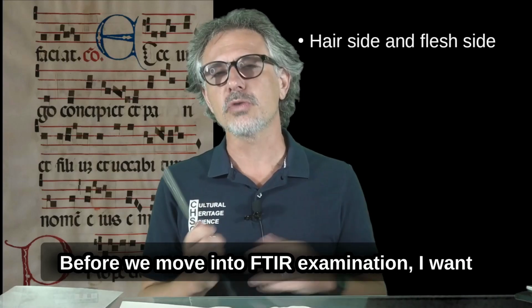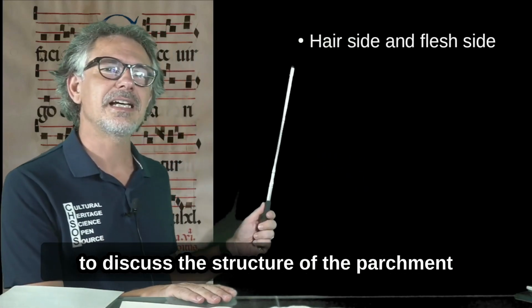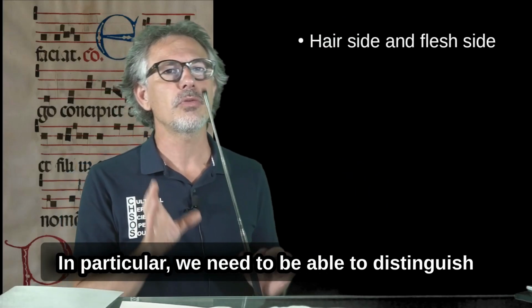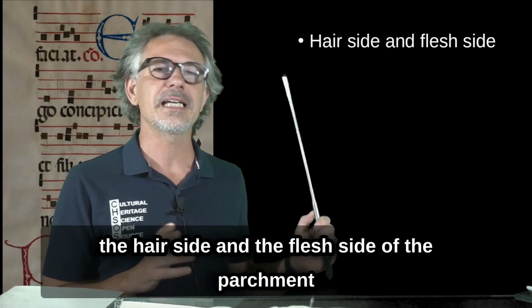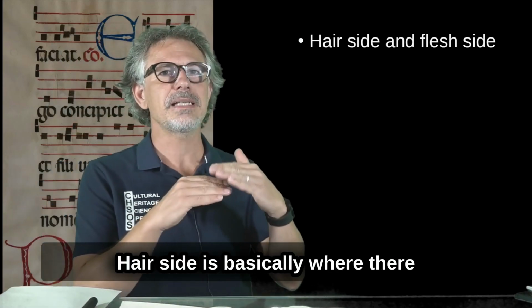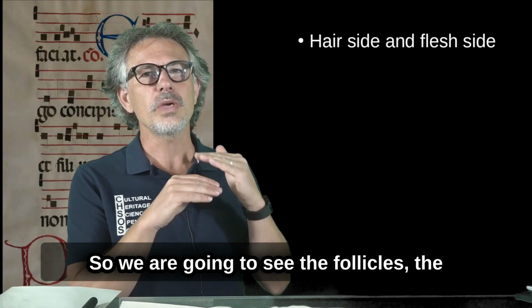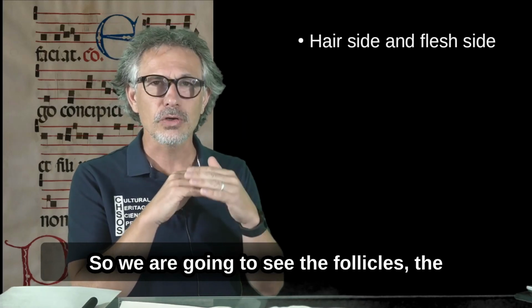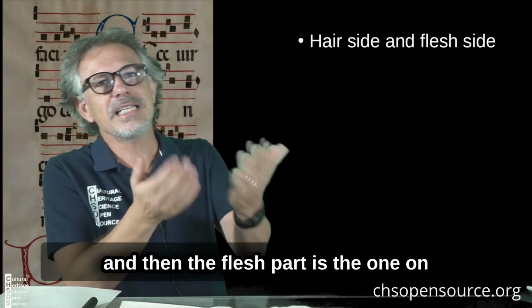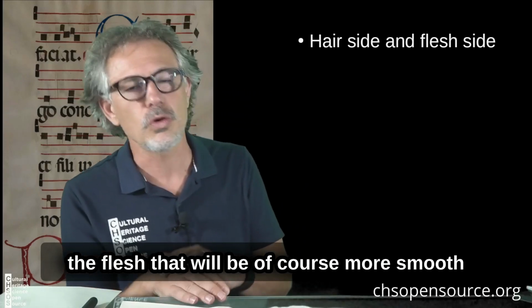Before we move into FTIR examination, I want to discuss the structure of the parchment. In particular, we need to be able to distinguish the hair side and the flesh side of the parchment. The hair side is basically where the hair was on the skin, so we are going to see the follicles, the structure of the upper part of the skin. The flesh side is the one on the flesh, which will, of course, be smoother.